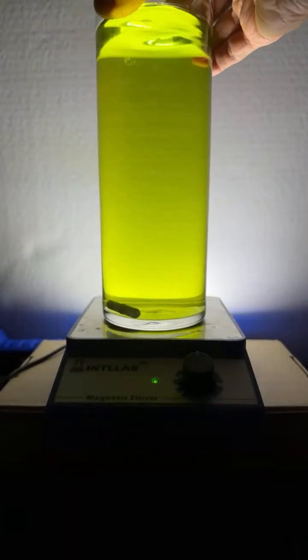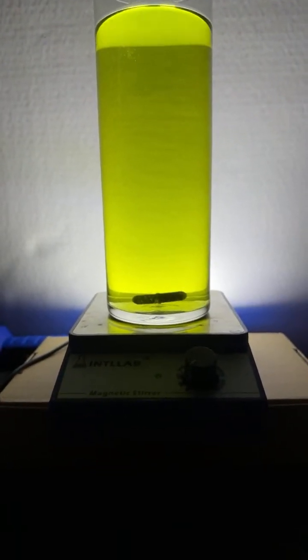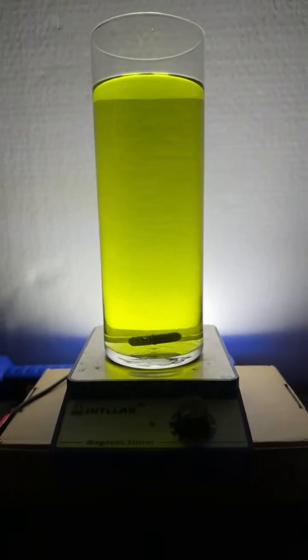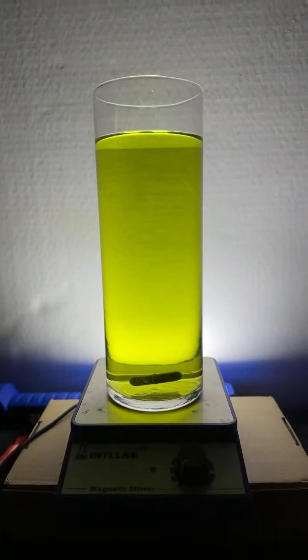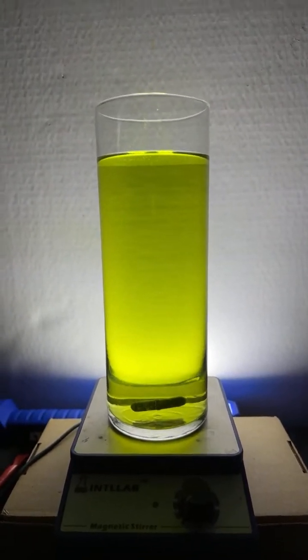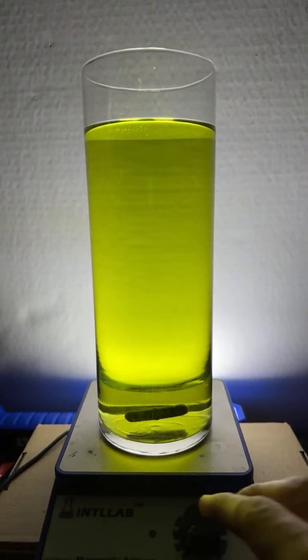Let's do the bubble experiment one more time. And then I think I'm gonna, let's see. Got to move it back. Got to move this up. Where's my... It's going to be right here. I like the bubble experiment. Let's get this on here. All right. Let me raise this up so I can see everything a little bit better. There we go. Oh, I love it. Carl's got the naming of the colors down for sure.